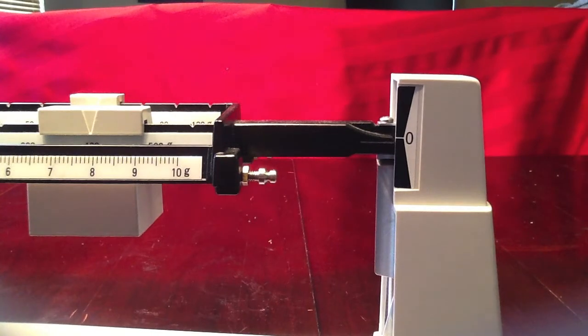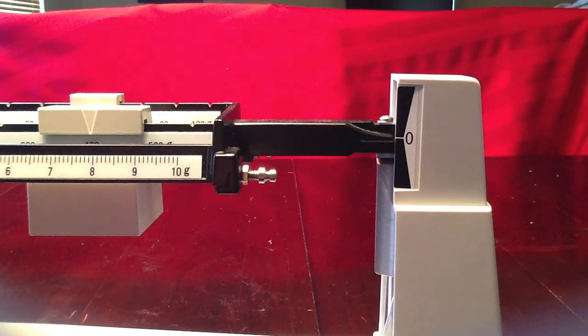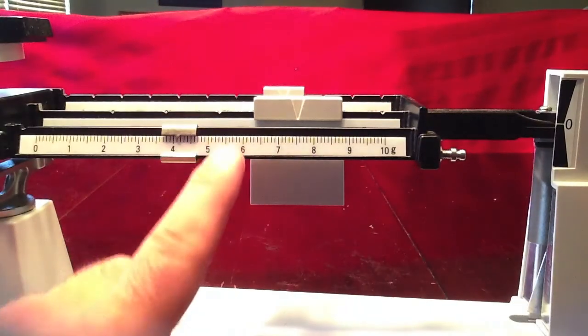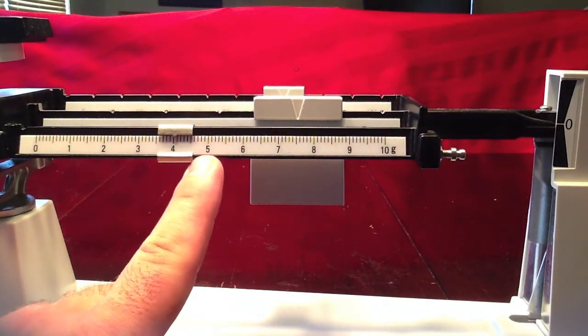As you can see, we are just slightly below the zero on our scale. So we're going to bump back our one gram rider just a little bit.